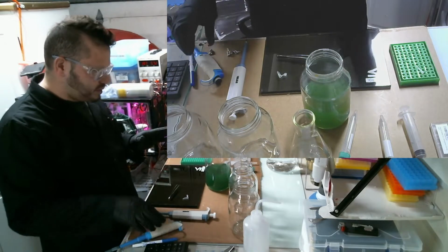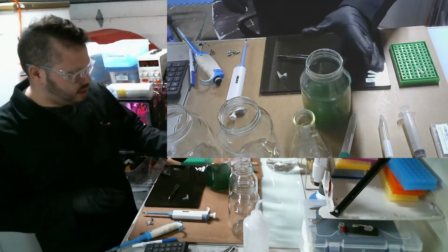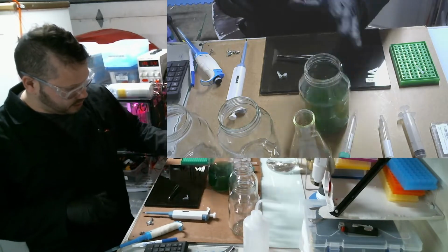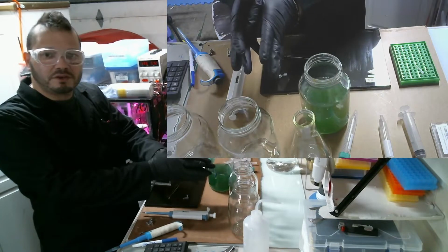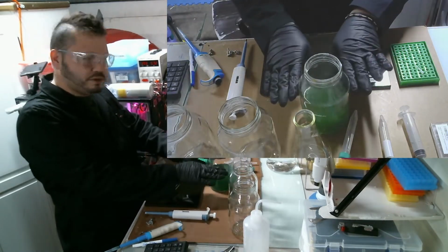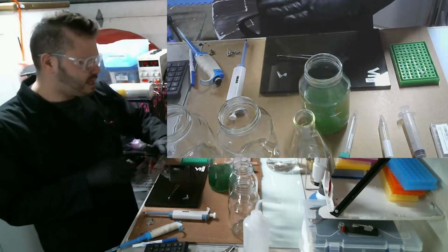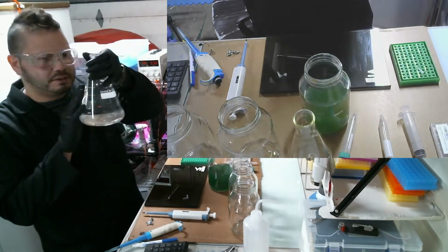So what I'm doing today is I'm actually starting the hormone experiment with the algae, and I've taken the algae out, as you can see here, and I'm going to mix it around a little just to make sure it's all mixed around. Essentially what I'm going to do is take 10 million cells out of here and then transfer them into each of these beakers, and then what's left here I'm going to reduce to 10 million as well, and then I'm going to use that to start the experiment, and then I'm going to bring it back up to 500 milliliters using this nutrient solution.